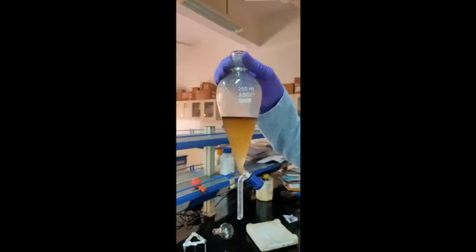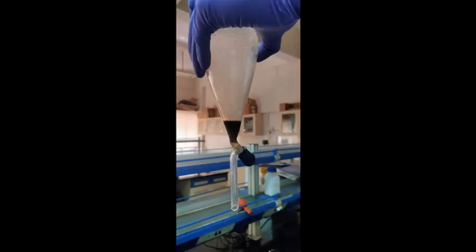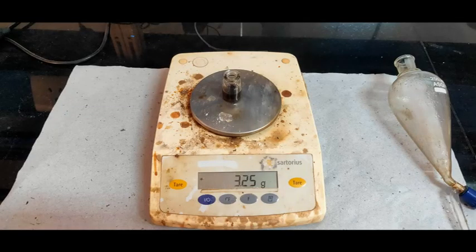Extracting lignocaine from solution. Extract using a separating funnel. The top portion will contain your desired product, which can be purified using column chromatography.